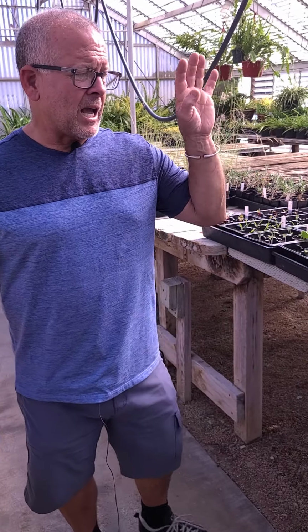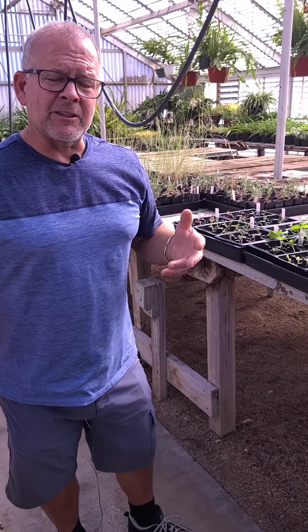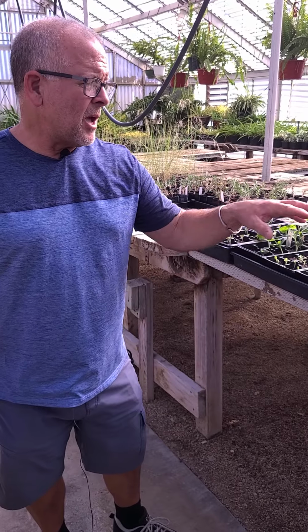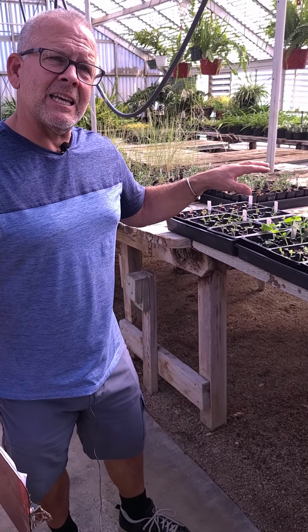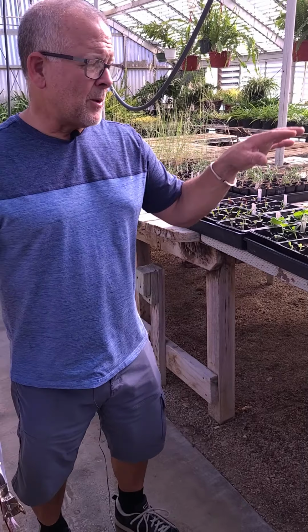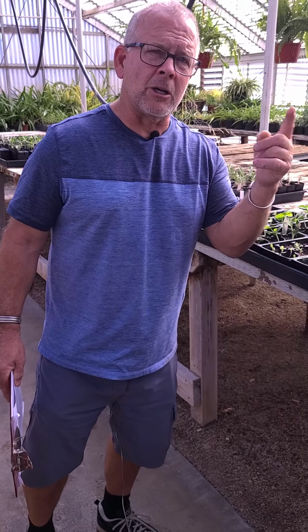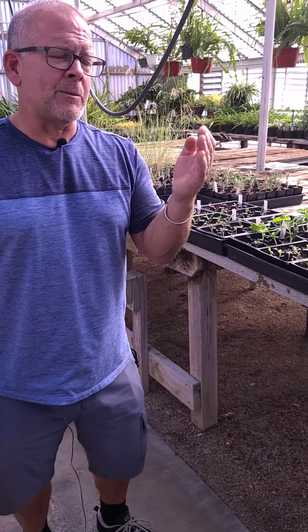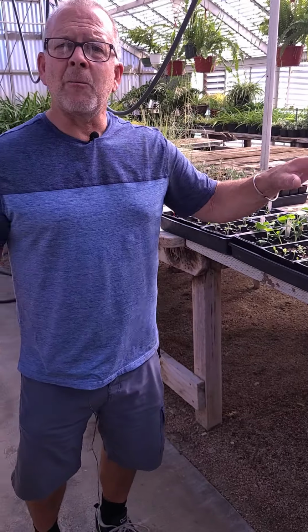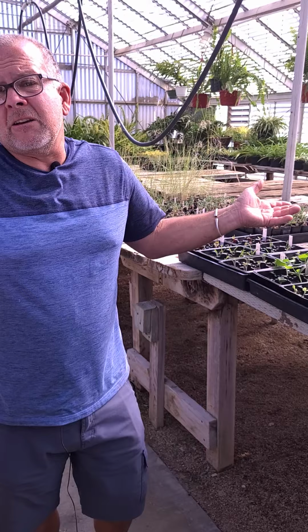But we're going to take that, and then we have 3 different treatments. And I've explained what the treatments actually are, and we will put different levels of salinity and sodicity in our treatments. And then we're going to grow each of these plants in each of those treatments. So perfectly good, all the nutrients needed, and then a low and a medium and a high salinity treatment. And we'll look at the comparison of how plants actually behave, how the different species behave, and if there's any effect at all on that.